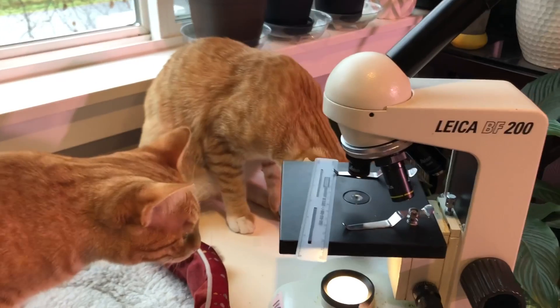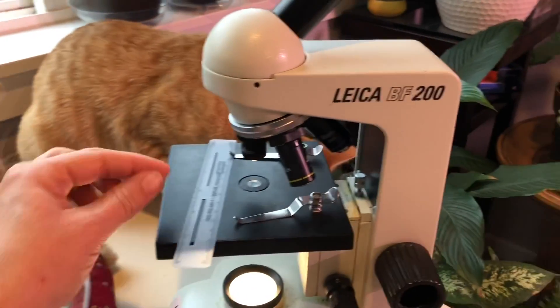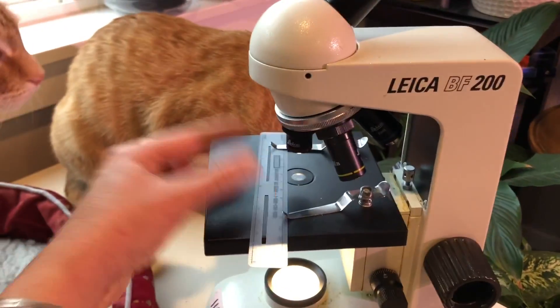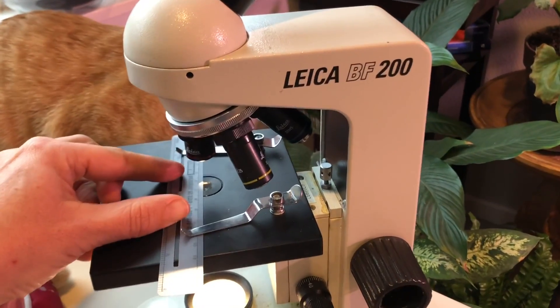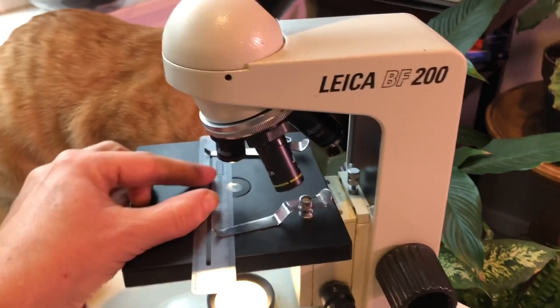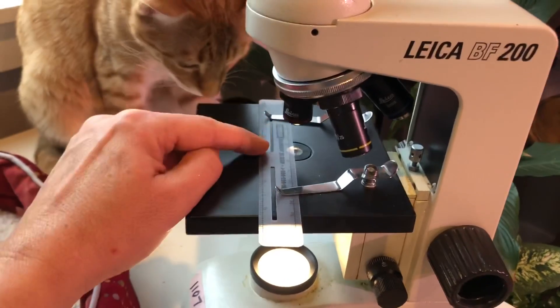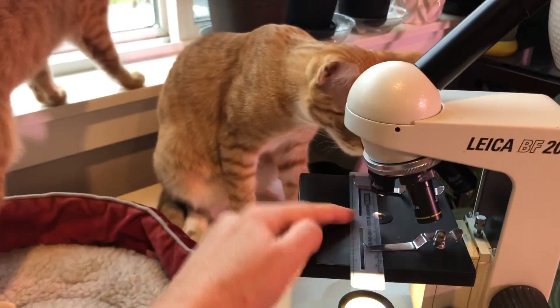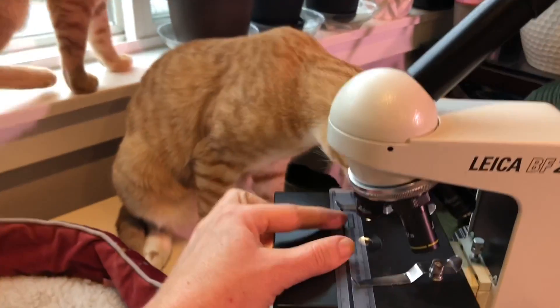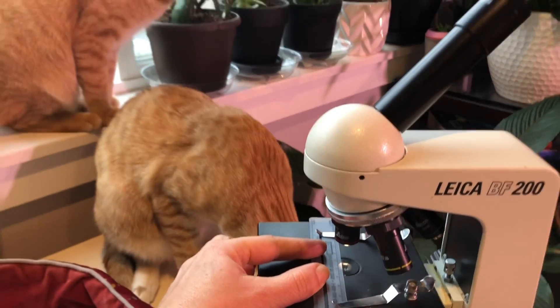I've turned my microscope on. The light source is on and I'm just going to slide the ruler directly so it's visible, right under the objective lens. It's right there, and now we're going to zoom in to what we see in the field of view.